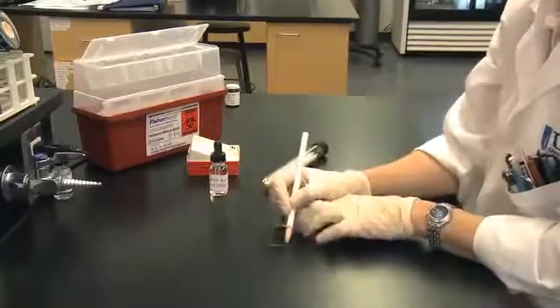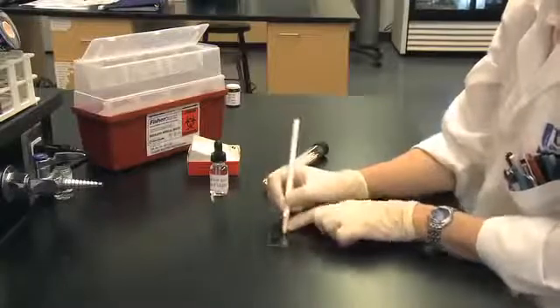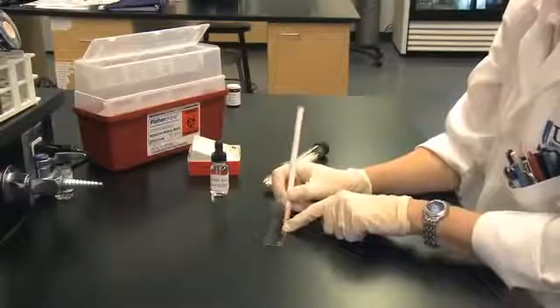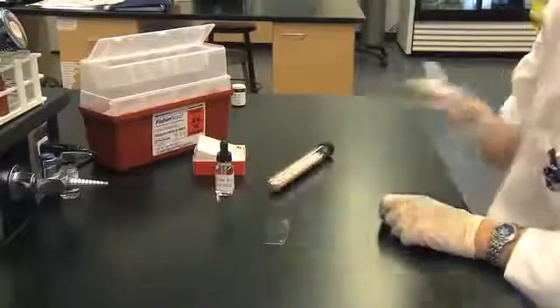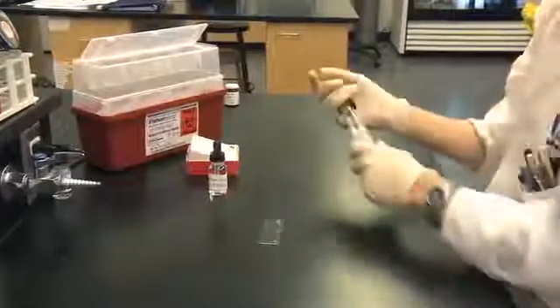Label a slide with positive control, negative control, and the test organism. All three tests can be performed on one slide.